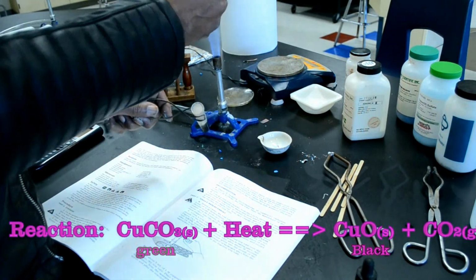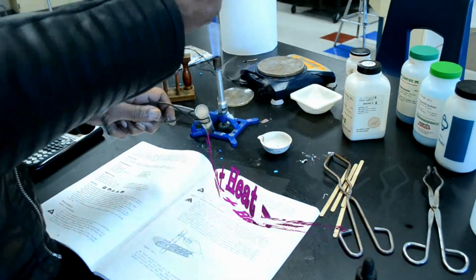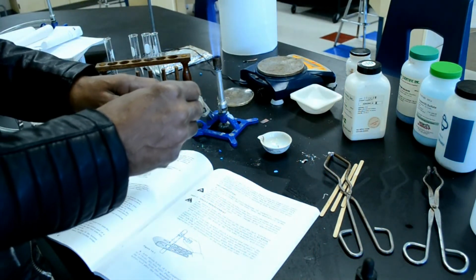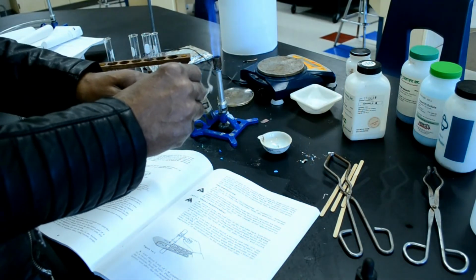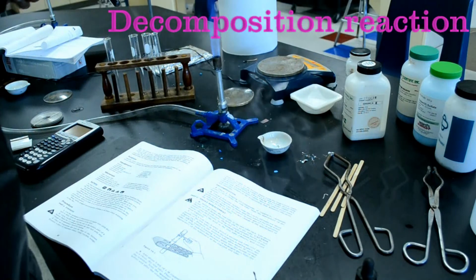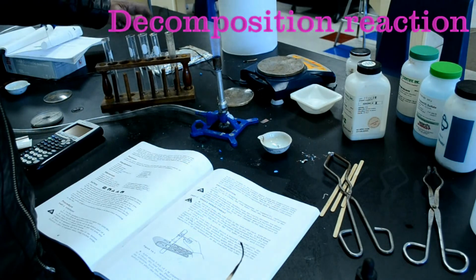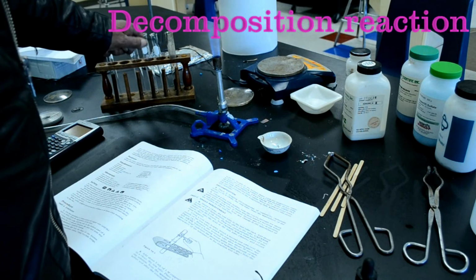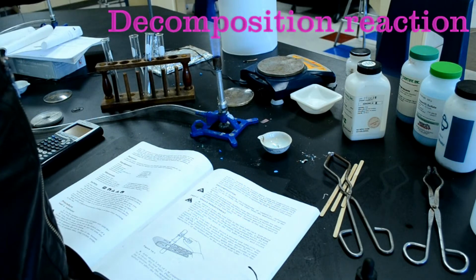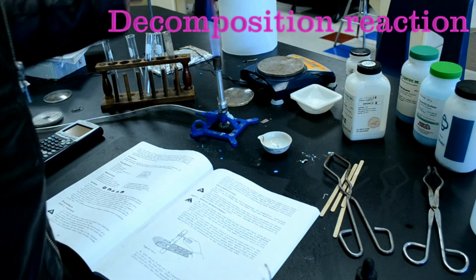That's because carbon dioxide gas is being formed, and some fire extinguishers actually use carbon dioxide gas to put out a fire. Fire will not burn in carbon dioxide gas. This is called a decomposition reaction because copper 2 carbonate formed copper 2 oxide, which is the black color here, and carbon dioxide gas, which actually put the flame out.